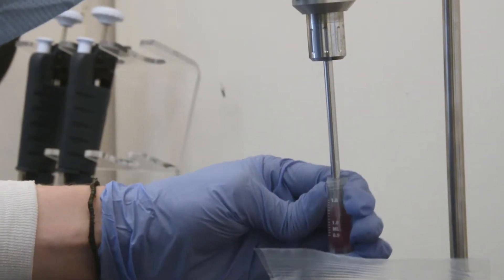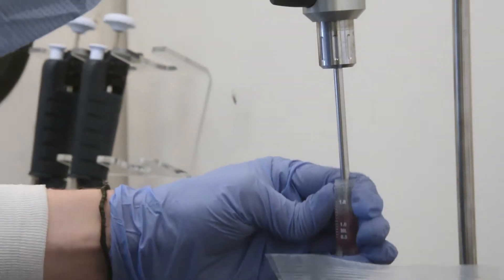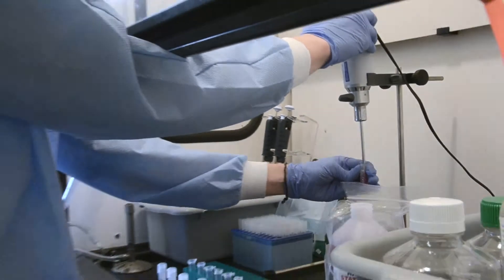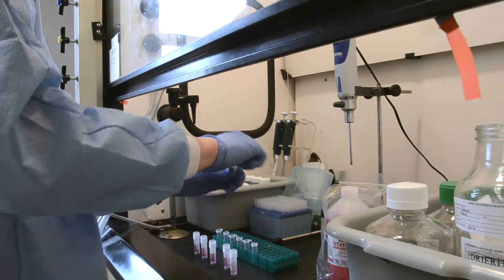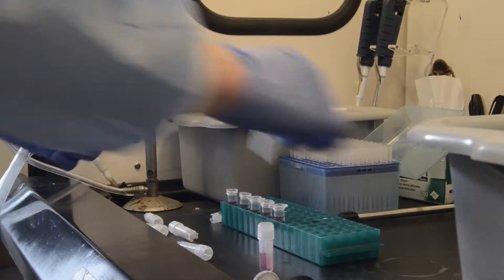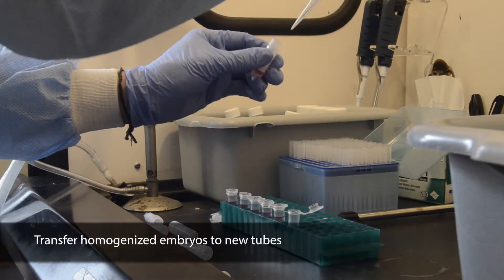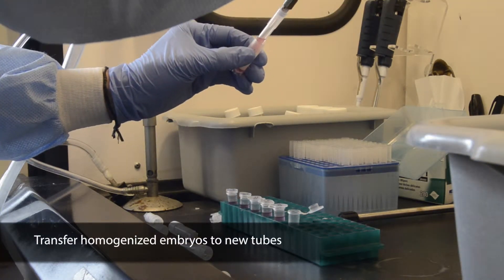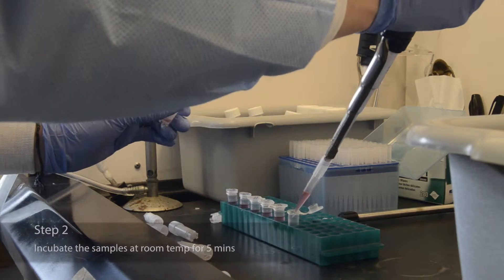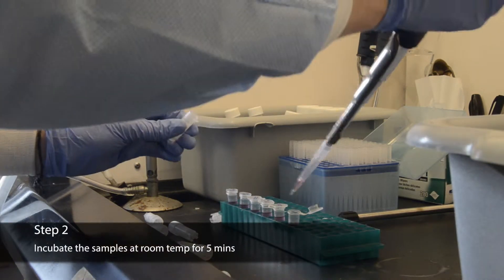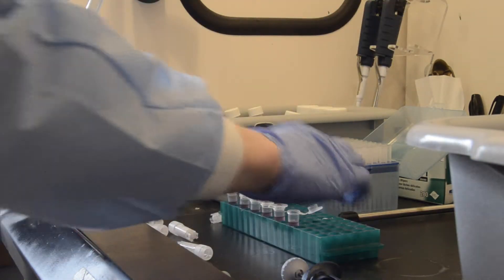Don't forget that if you are doing multiple RNA extractions, then the homogenizer must be washed with the three labeled rinses of water and wiped with a new chem wipe between each sample. There are a number of different methods to performing the RNA extraction. The method shown here involves transferring the homogenized embryos into new microcentrifuge tubes. The embryos are then incubated at room temperature for at least five minutes and no longer than 20.